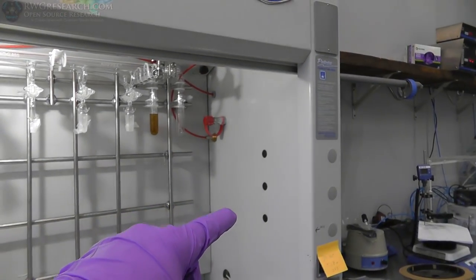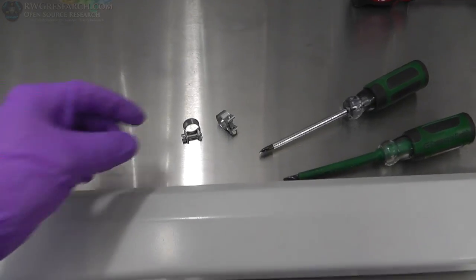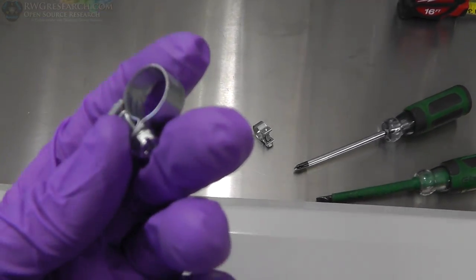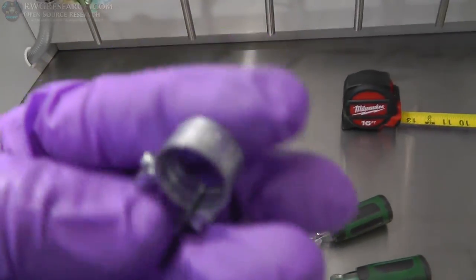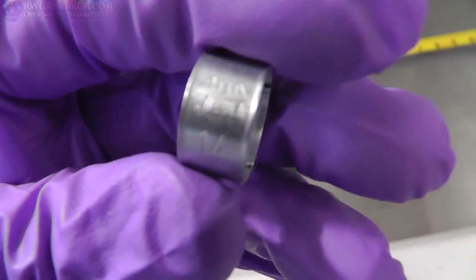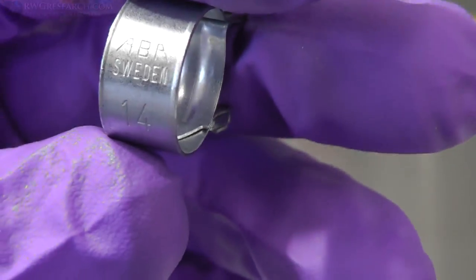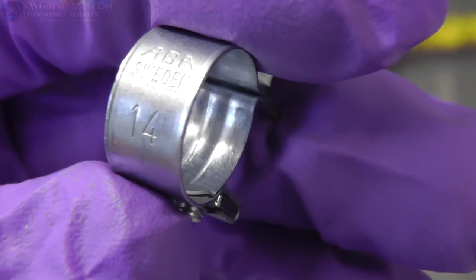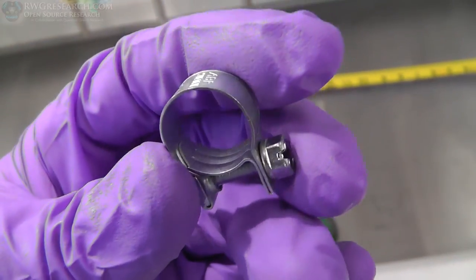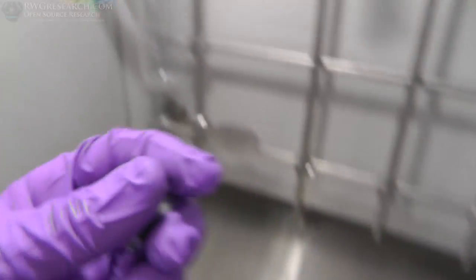We got these valves in. I think I'm gonna put those in right now. Let's check it out. Before we move on to those valves, I wanted to show you these clamps. So I had a set of these clamps in my collection of things, and so I went ahead and ordered some more. And these are ABA clamps. All right, these are a special type of clamp, as in they don't have the ribs on them, kind of like this clamp.